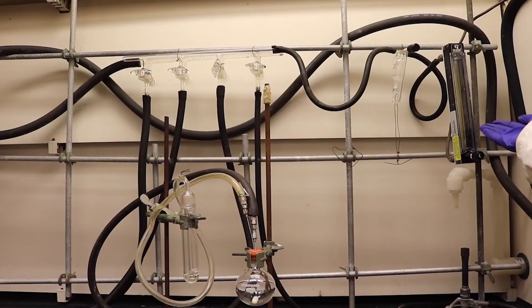In the full setup, the argon gas will be flowing first to the argon flow meter, then the first bubbler, then the manifold, the inlet tubing, the round bottom flask, the outlet tubing, and finally the second bubbler. If the argon gas is successfully traveling throughout the full setup, you are ready to flame dry.